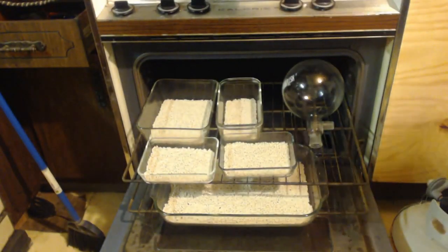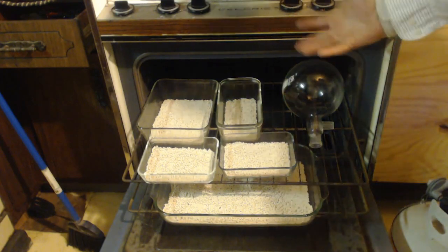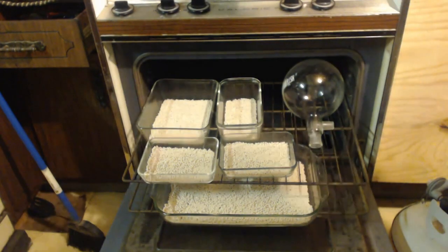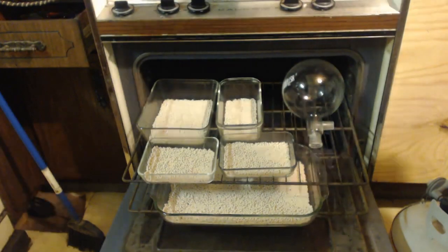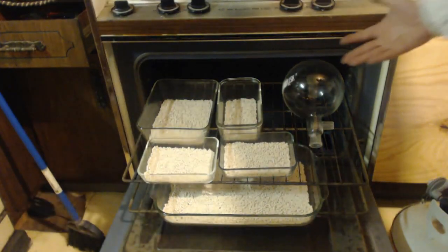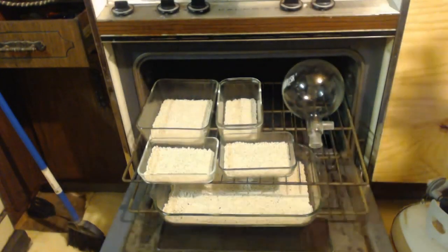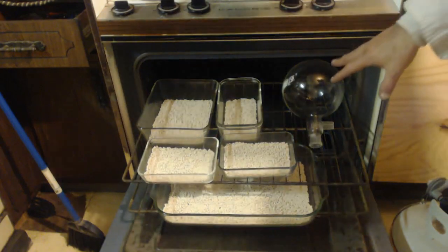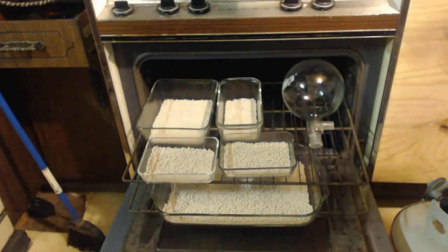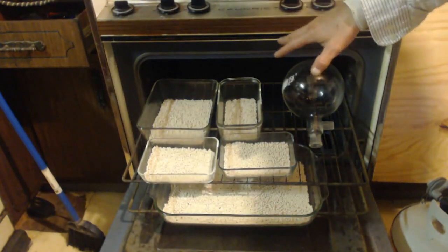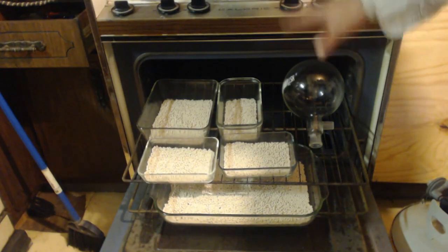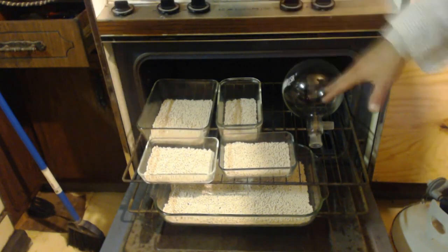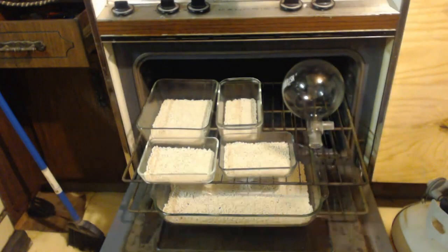We're going to put this in the oven just like anything you can dry it out. You've got to be above 212, right? Because that's what temperature water boils at. So the lowest you can do this at 250. I don't suggest you do it that low. Molecular sieves really anywhere from 250 to 450 degrees Fahrenheit. I'm going to do it at 400 degrees for two hours.